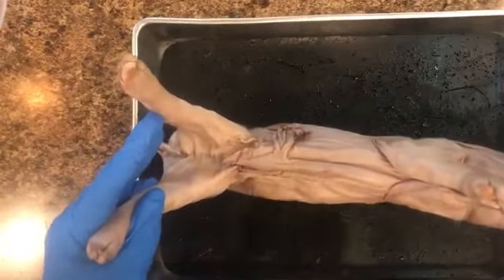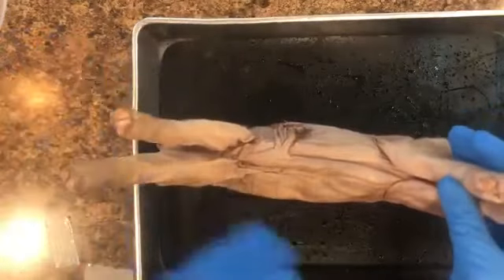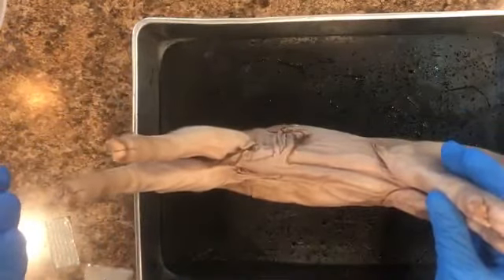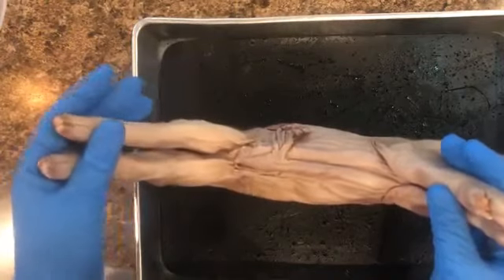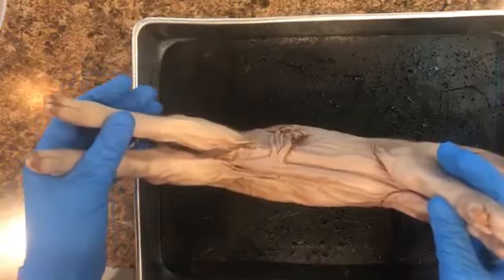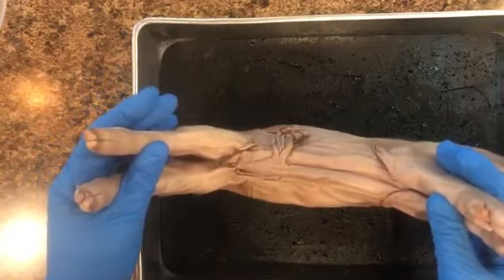While they're in the uterus, of course. So there are different types of specimens that I can order. There are ones that are injected or ones that are non-injected. Injected meaning they put a latex inside the different blood vessels. So arteries would be red and veins would be blue.